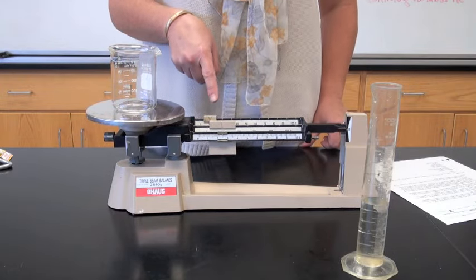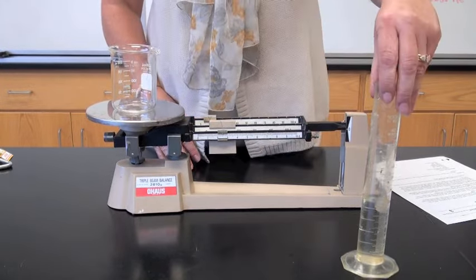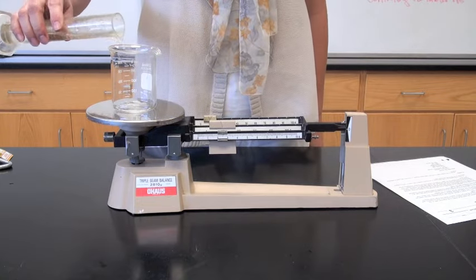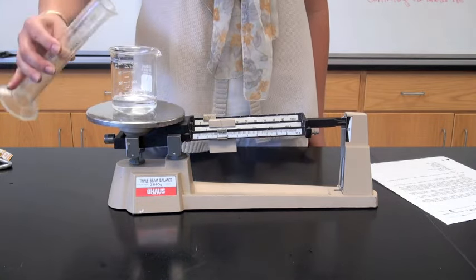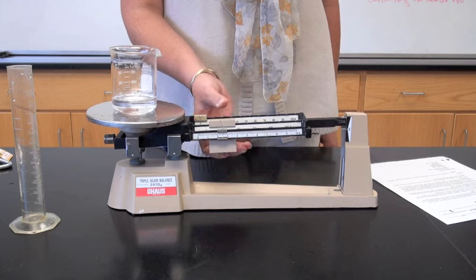Add up these numbers, and there you are. Then you have to pour in the liquid, and start again, all the way back to zero.